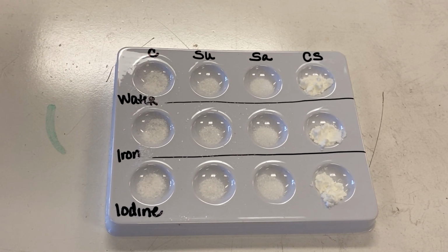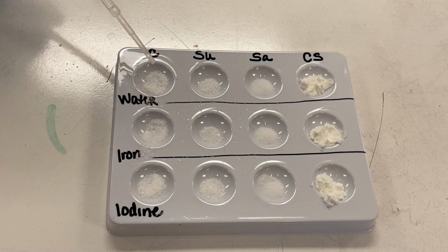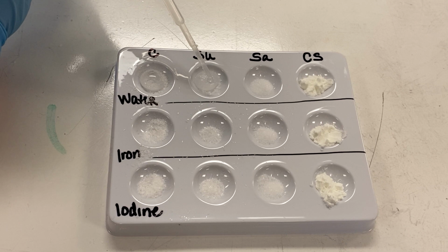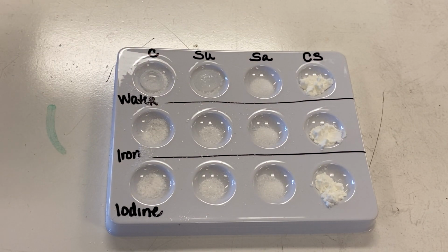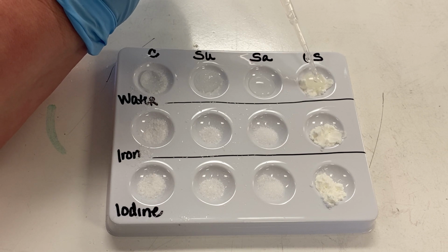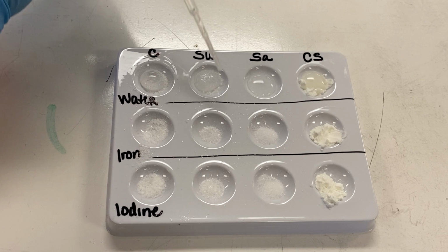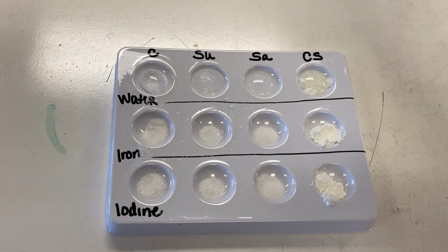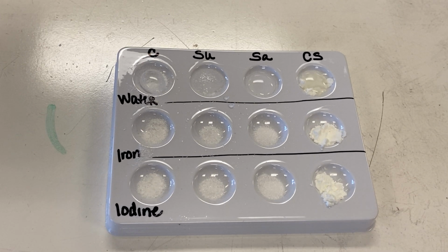Okay, now I'm going to add the water. And again, it's asking us for distilled water, of course, because it contains no chlorine or chemical additives. So I want to add enough water in here that I can get a good analysis. See what happens here. Okay, I have some toothpicks here, so I'm just going to use a different toothpick, of course, for each mix here.